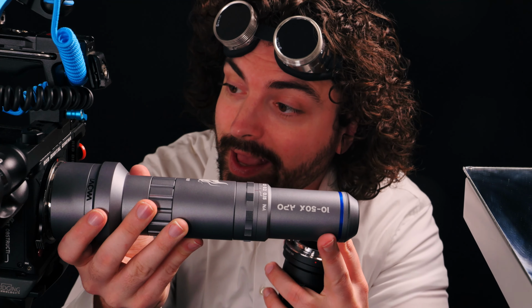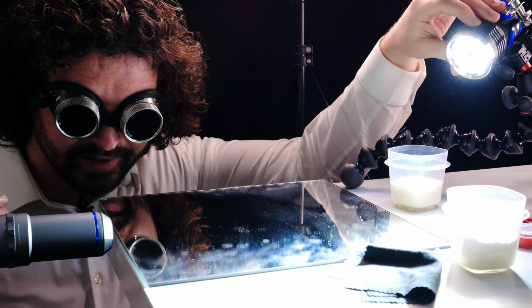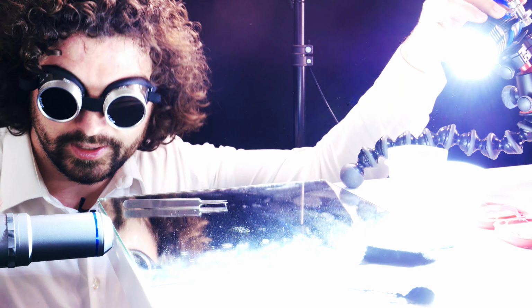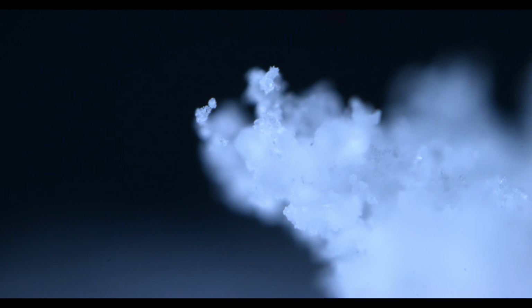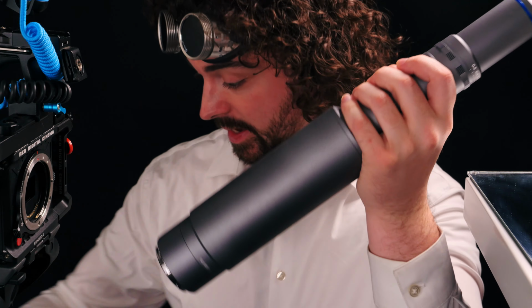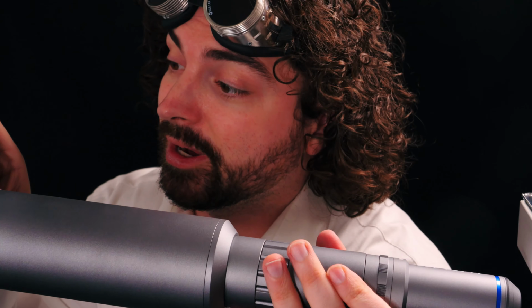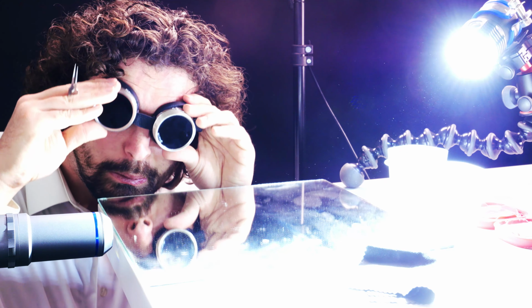All right, let's go from 2x magnification to 10x magnification. You're gonna need a lot of light for this. And that's tiny. More magnification. 20x magnification. Okay, that's better. 50. And that's not happening. I have no idea if this is gonna work. Kind of works like a fractal. It's kind of crazy. That's pretty good.